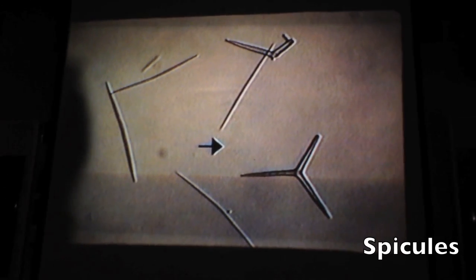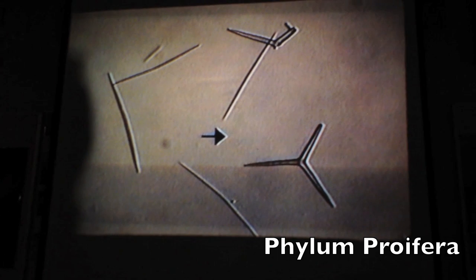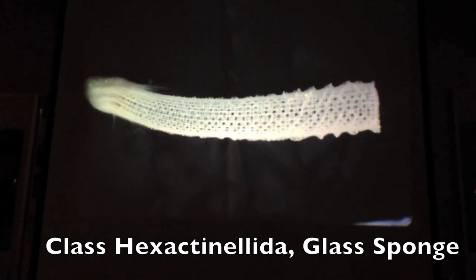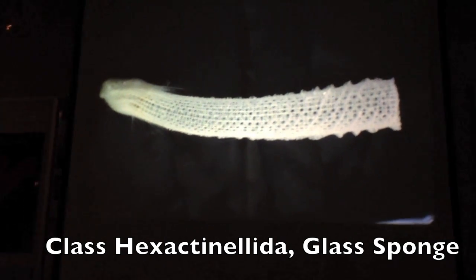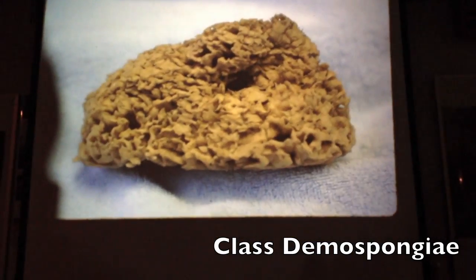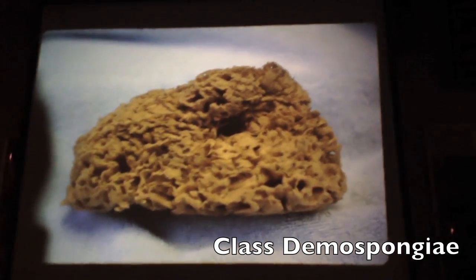Spicules. And what phylum do they belong to? Porifera. Porifera. Sponges. What kind of sponge is that? Hexactinellida. Hexactinellida, that's the class, yeah, glass sponge. Which class would this be? The one that almost all sponges are in, Demospongiae.